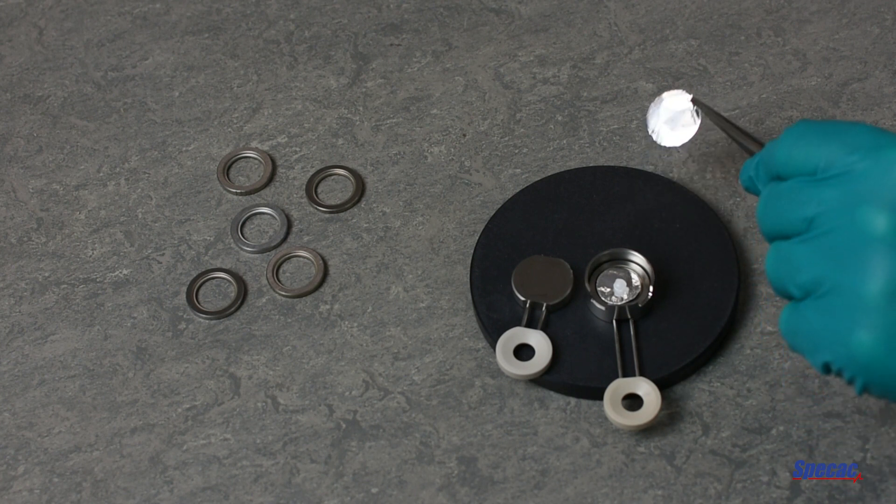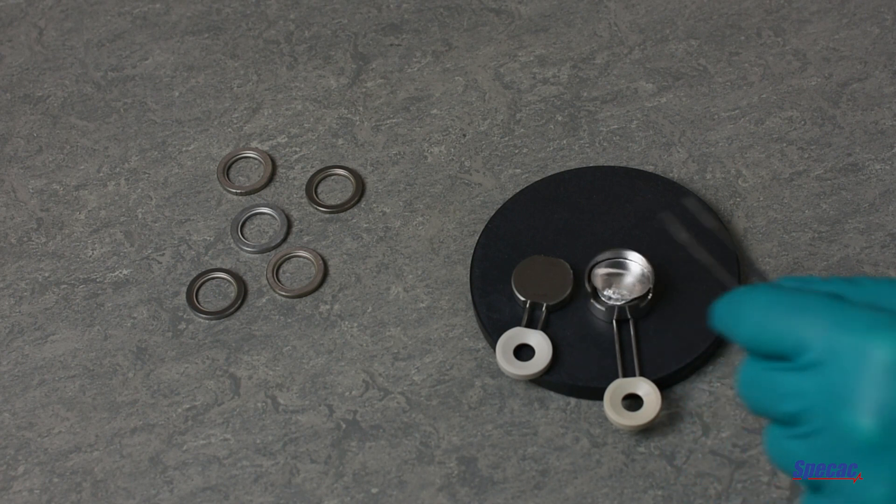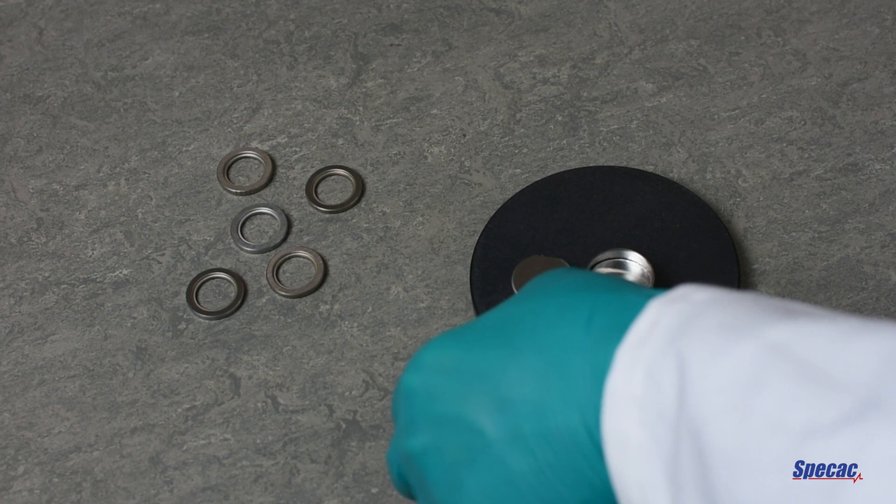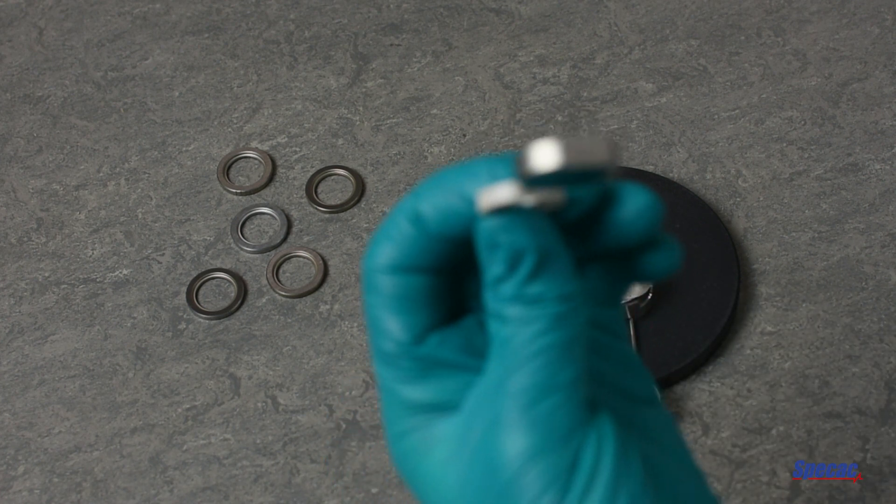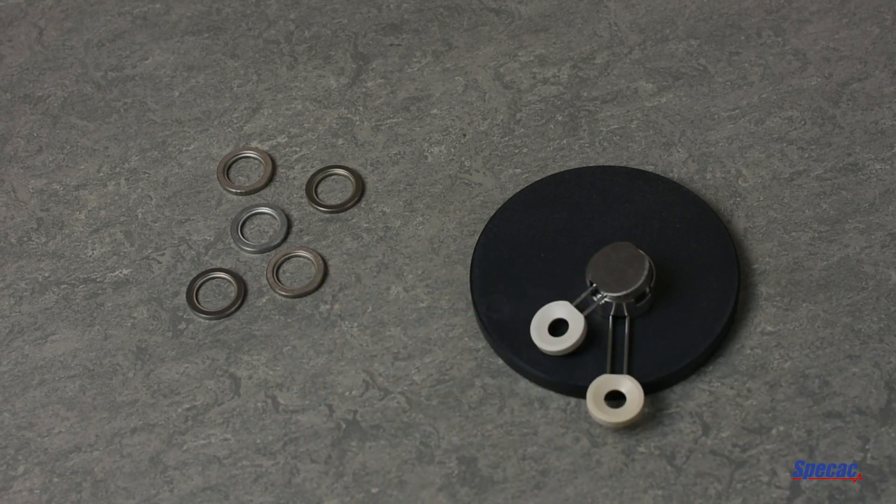Now, the sample is covered using a larger diameter foil. Finally, the upper plate is brought gently into position on top of the foil.